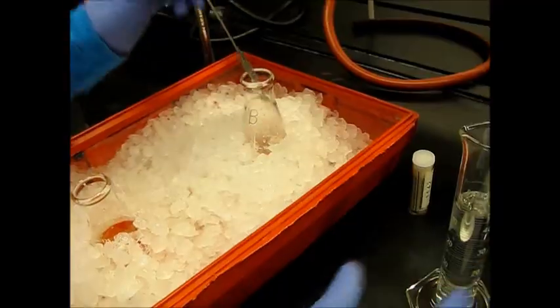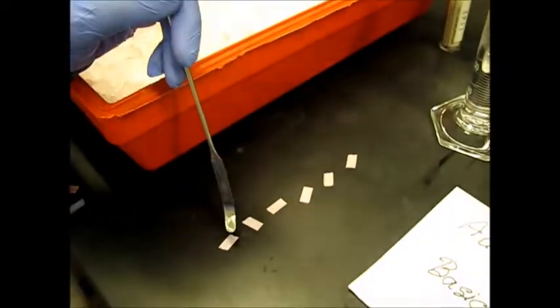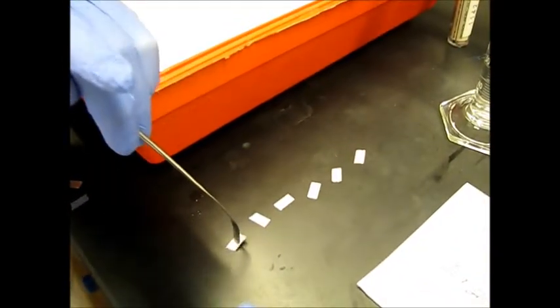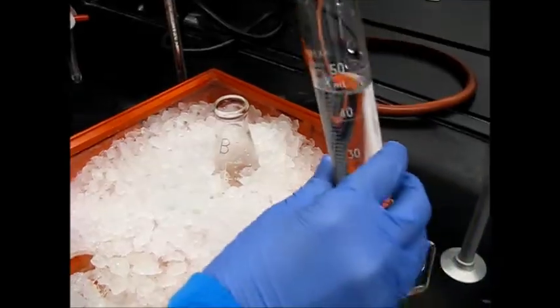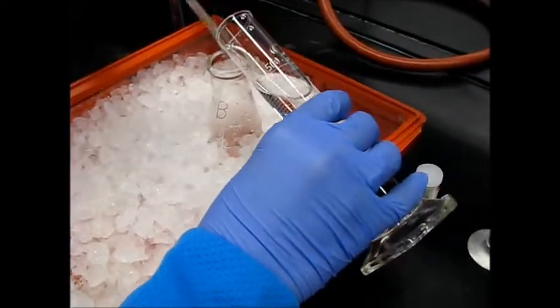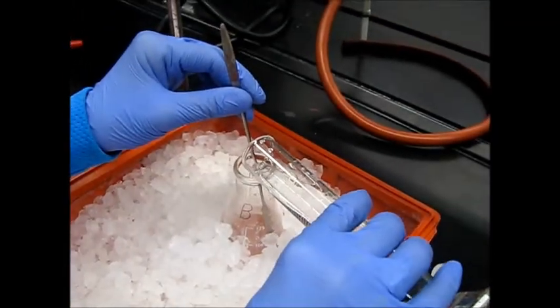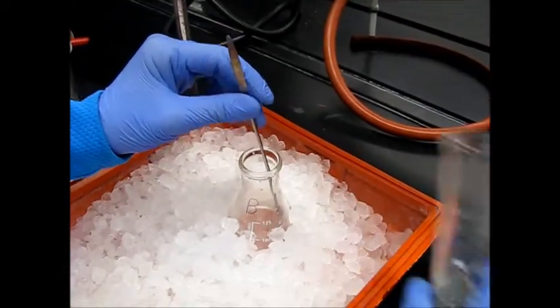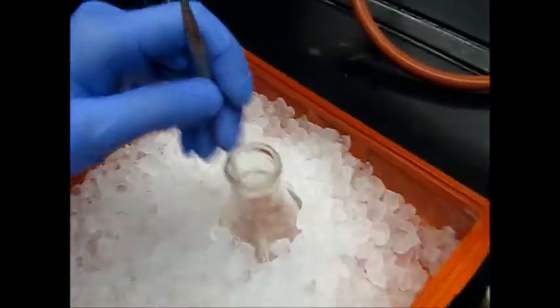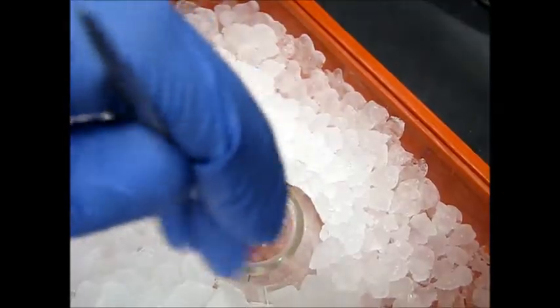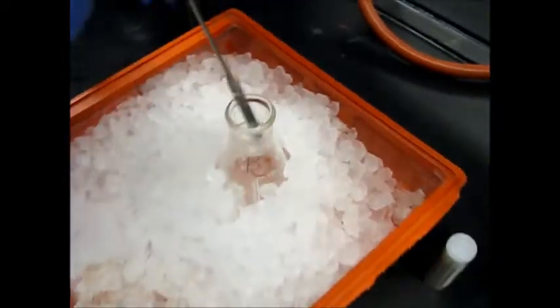So first we start testing pH so that we know if it is basic. Very basic. Very blue. So now I will add about 15 milliliters of 4.5 molar HCl and then stir. And then test the pH again.